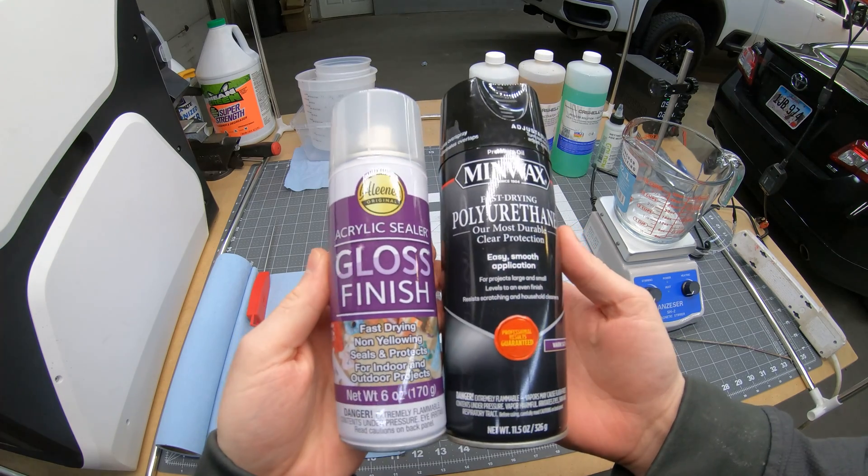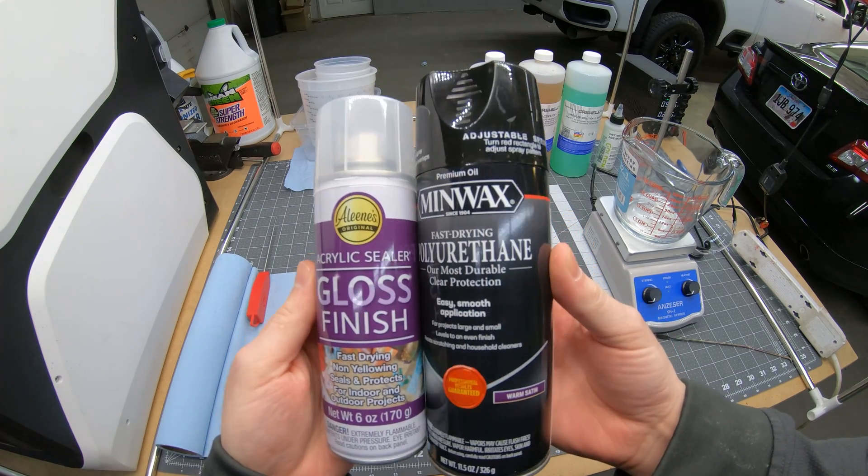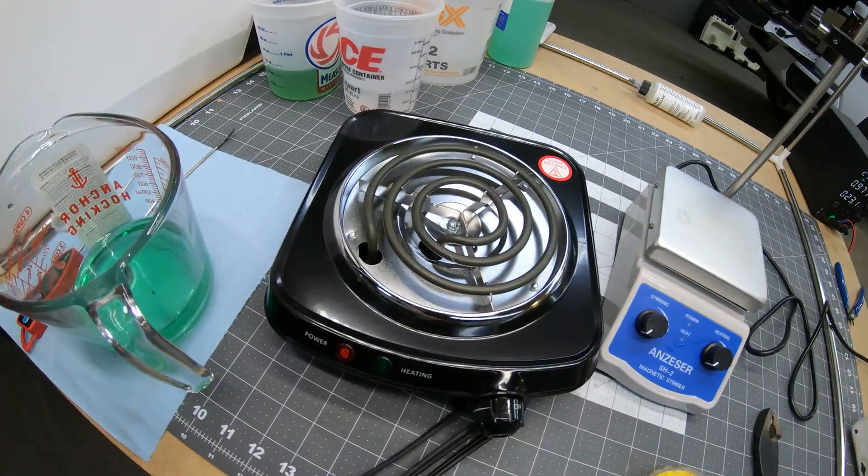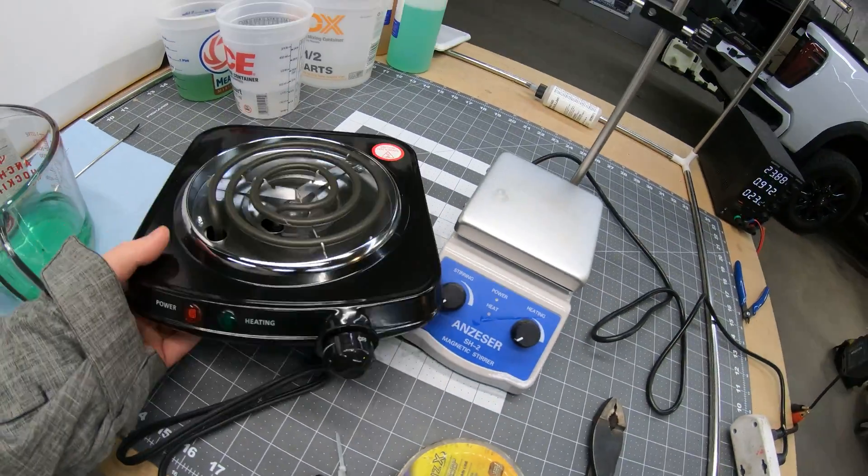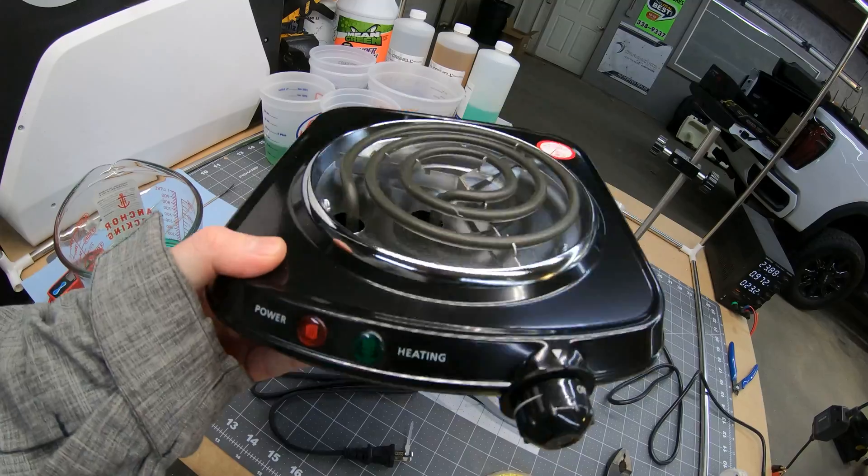To test this out, I tried coating the samples with different types of plastic, and I got similar results. Then I thought getting the bath hotter might help it. So I bought a different heating plate, got the same exact results.